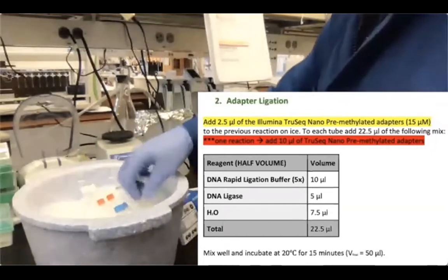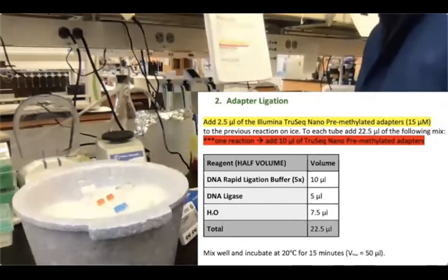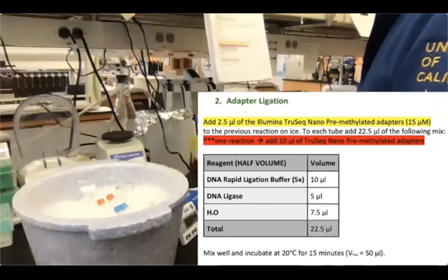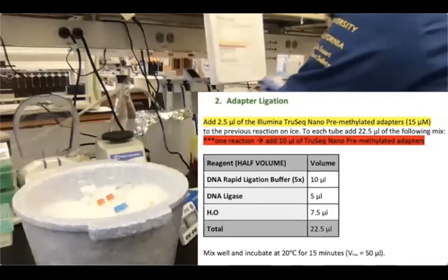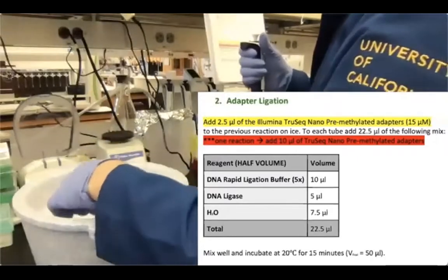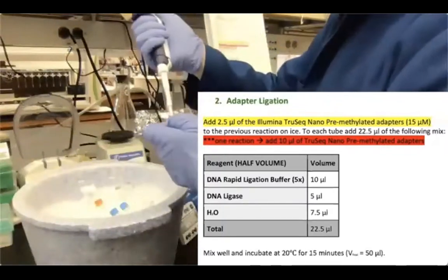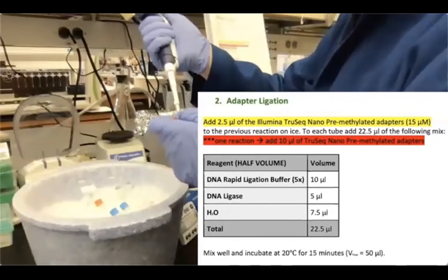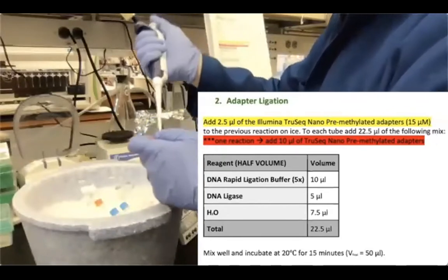okay? Once I have my adapters mixed into my samples, I am adding the ligation buffer, so it's 10 microliters of the ligation buffer. Also, this buffer is very viscous, okay? So please pipette it slowly, otherwise you're not gonna pipette an accurate volume.